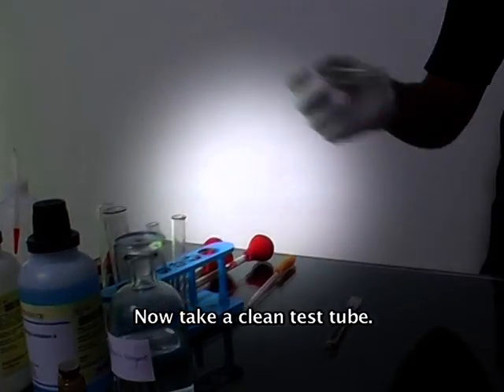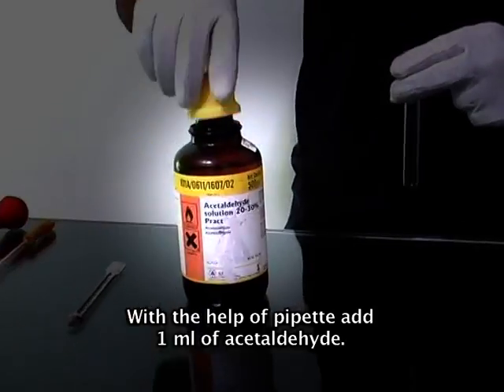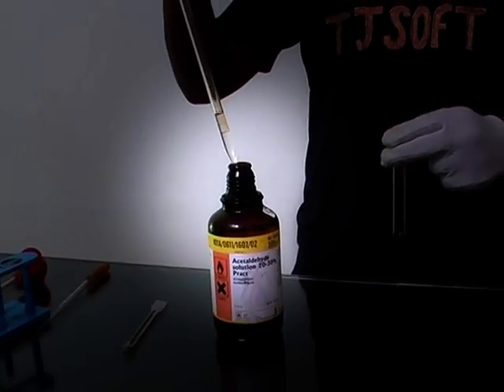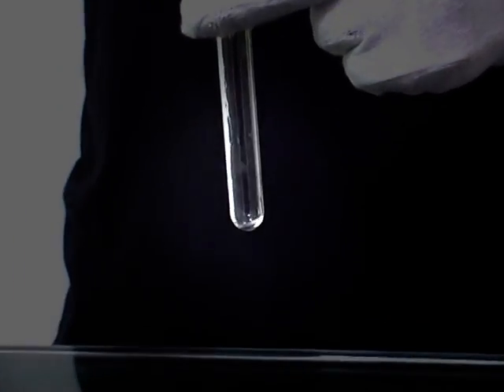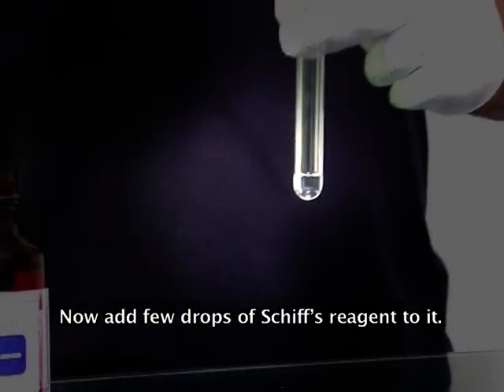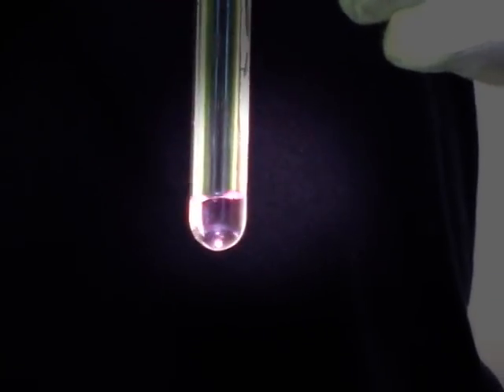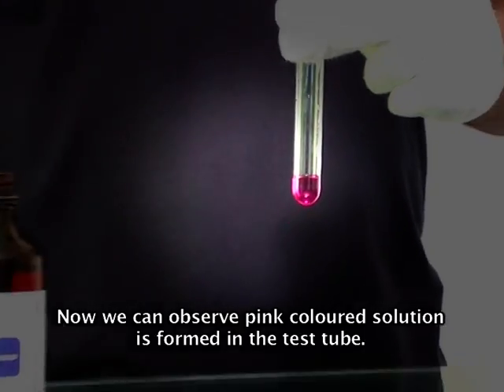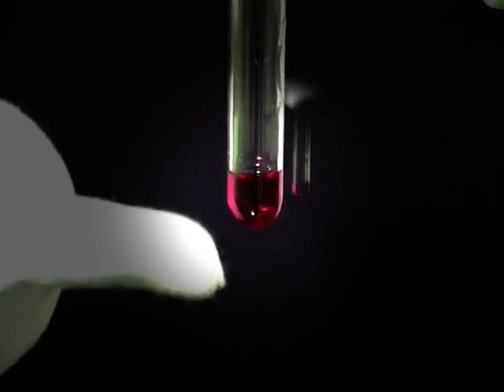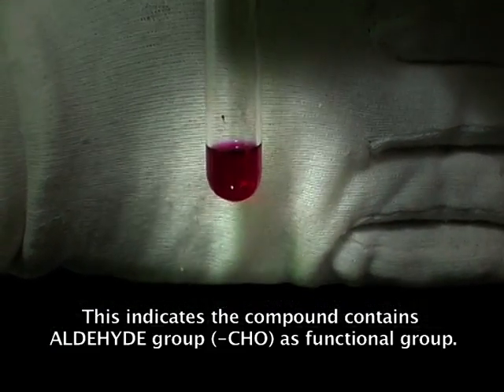Now take a clean test tube. With the help of a pipette, add 1 ml of acetaldehyde. Now add a few drops of Schiff's reagent to it. Now we can observe a pink colored solution is formed in the test tube. This indicates the compound contains an aldehyde group as the functional group.